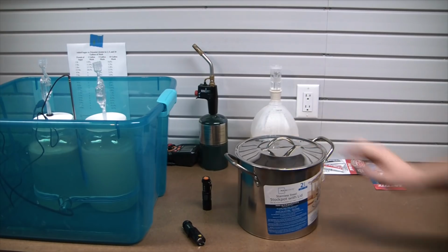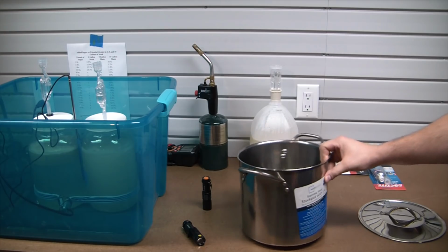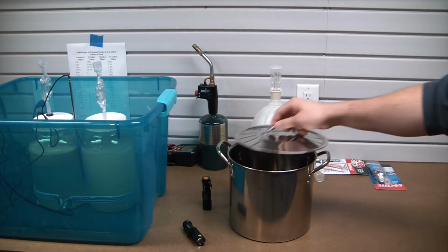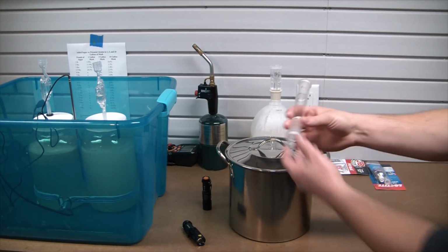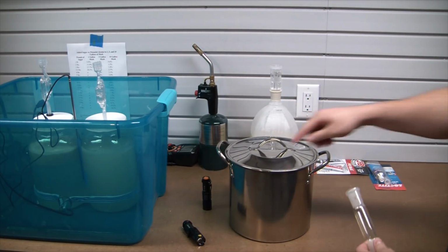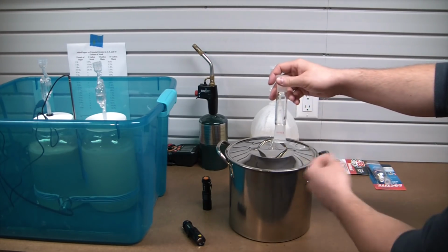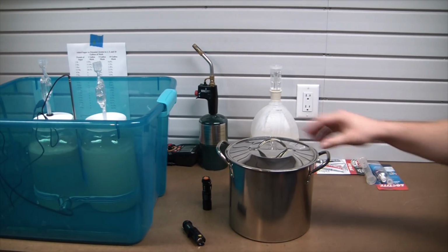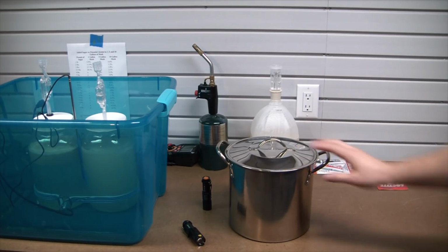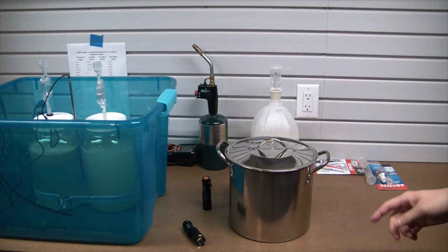Got this cheap stainless steel stockpot from Walmart. What is it, 8 quarts? Like $7. Probably not the best grade of stainless steel, but it is stainless steel. And what I'm planning on doing is using this 24/40 adapter, gonna cut it down the center and solder in a copper piece that'll basically slip fit with an O-ring or some PTFE tape, so I can adapt glass chemistry distillation glassware to this stockpot. And obviously we'll have to seal up the lid, but we should be able to make this sucker work.